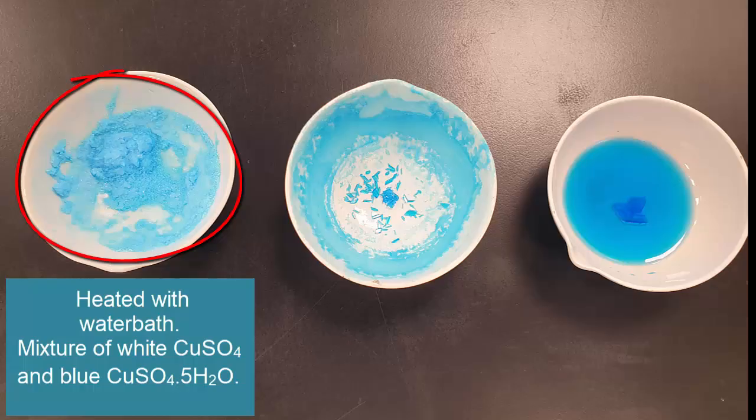And so that is actually a mixture of two different compounds in a sense. Not only is there no pure crystal, so it's not pure. So I wouldn't actually ever do that method. It might work or be useful for some other circumstance where you want it to just heat up at 100 degrees and not go over, like a hot water bath at 100 for some other sort of experiment. And it might work for some other sort of crystals, but certainly for copper sulfate and for every other crystal I've ever done as well, by the way, you do what the textbook says.